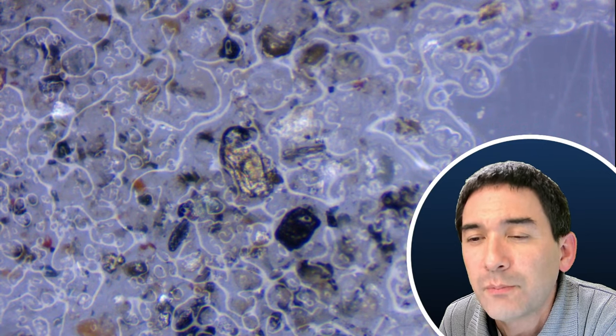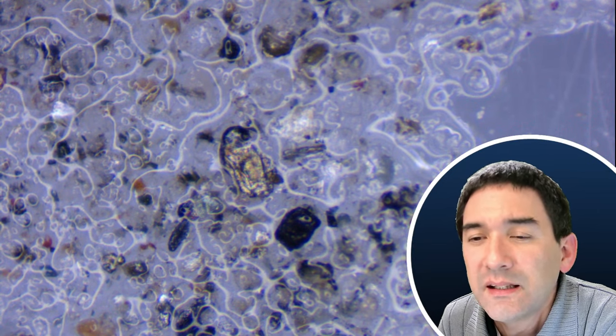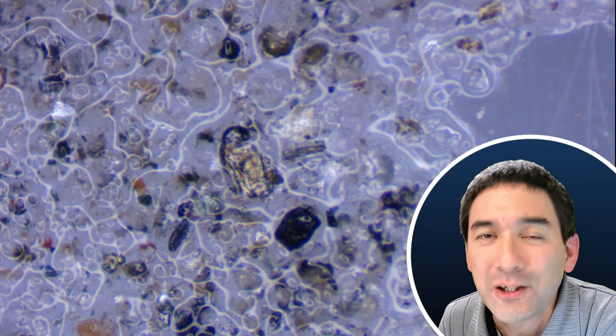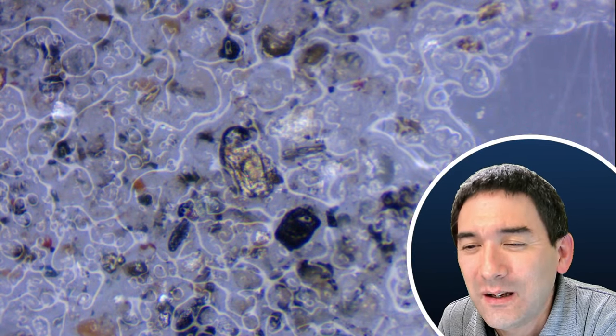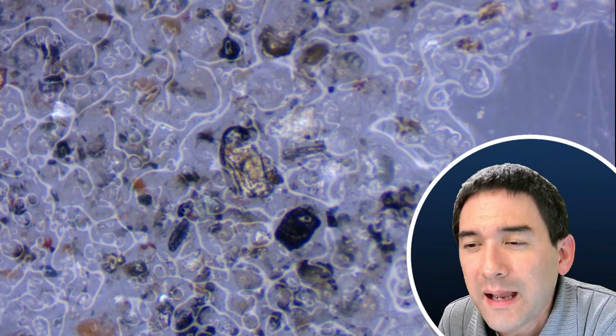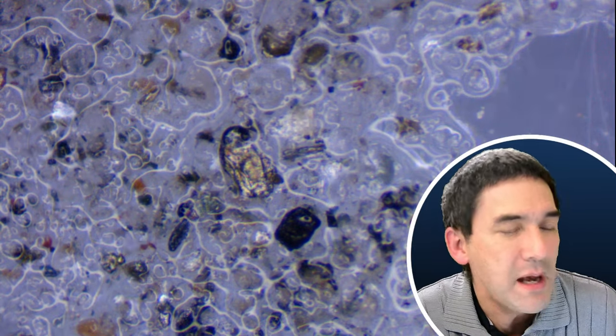Small crystals of pyrite were used as diode detectors — yes, when I was a youngster I also made diode detector radios. Would pyrite look better with polarized light? I think with light coming from the bottom you might not be able to see it because it's too dark. But I'm going to try it out and switch over to the compound microscope to look at the sand sample.